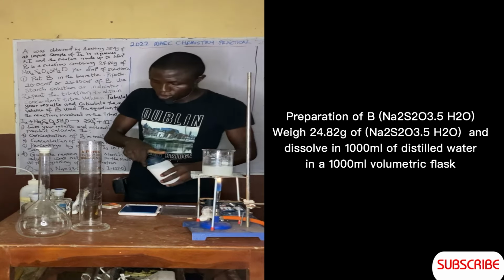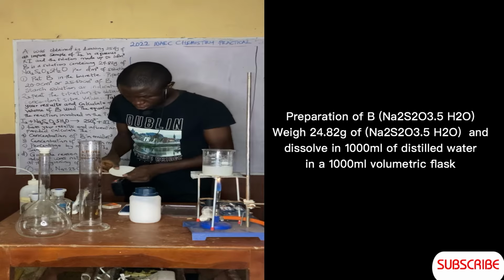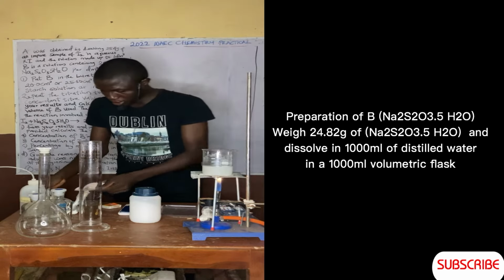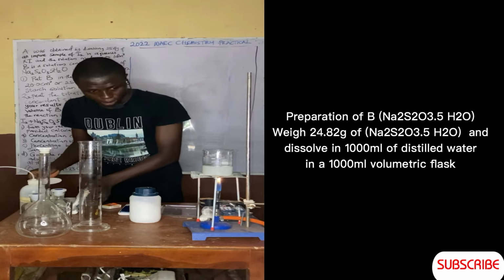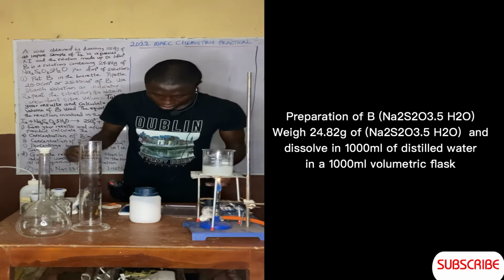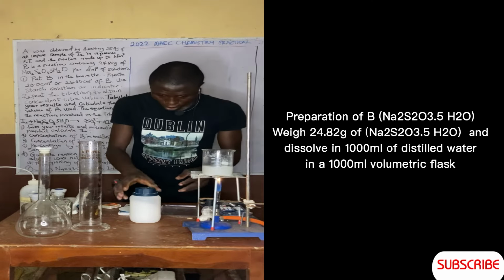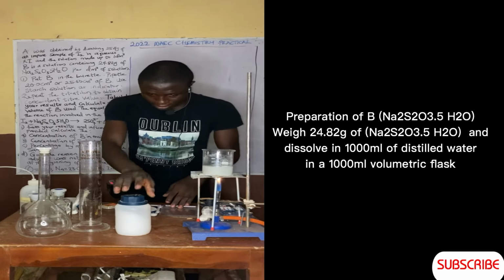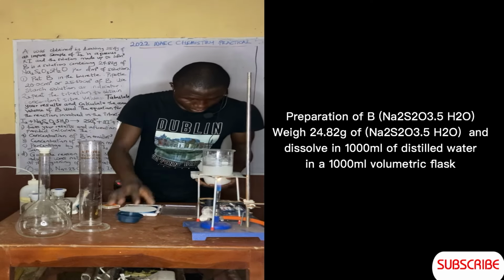24.82 grams. So make sure this thing is not contaminated. You can decide to use another filter paper for your measurements. Remember, we are waiting for this one to boil for 5 minutes. So I'm checking my time for it as well.